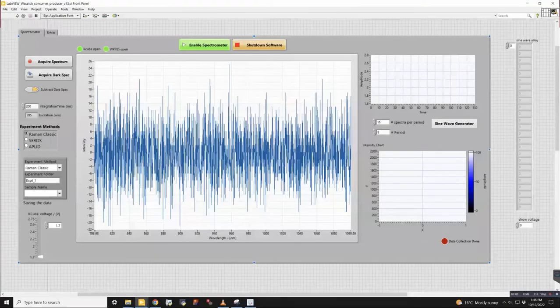Okay, it looks like the audio is working. So we're going to go over all the back-end LabVIEW stuff on how to operate the APLID instrument.